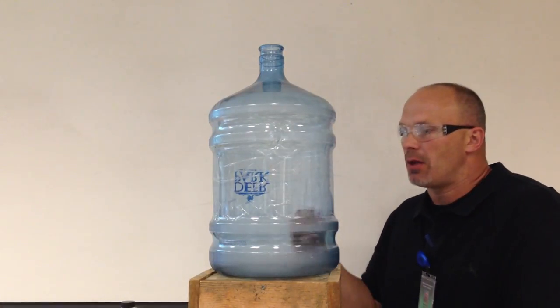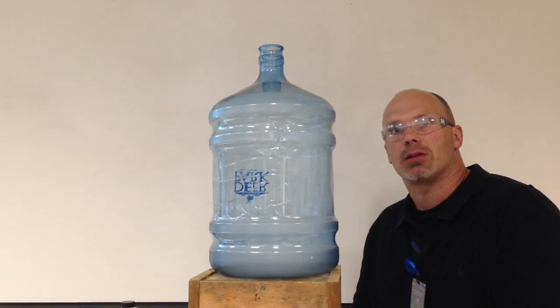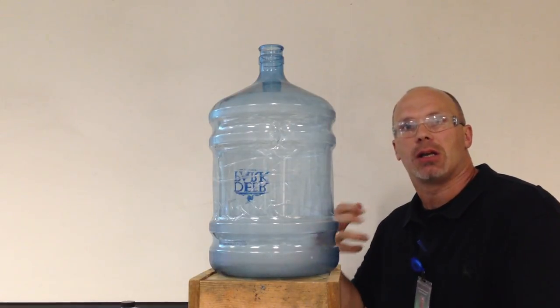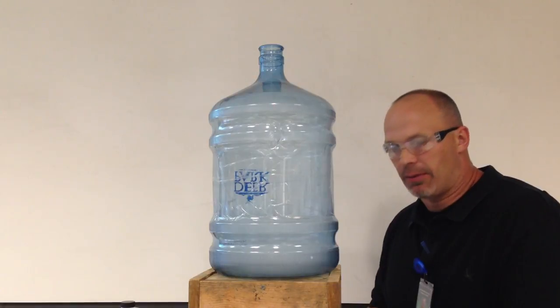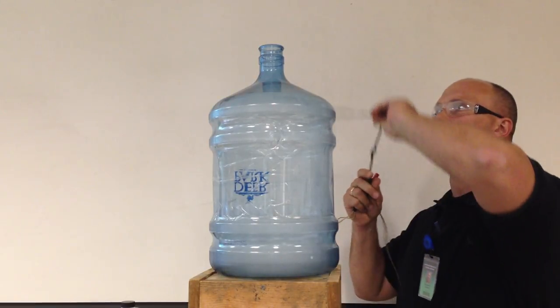And then eventually, you're left with just the carbon interacting in the cellulose to the oxygen. And you don't have the liquids evaporating. So, in any case, I'm going to put this sparker in here and try not to get the end wet.